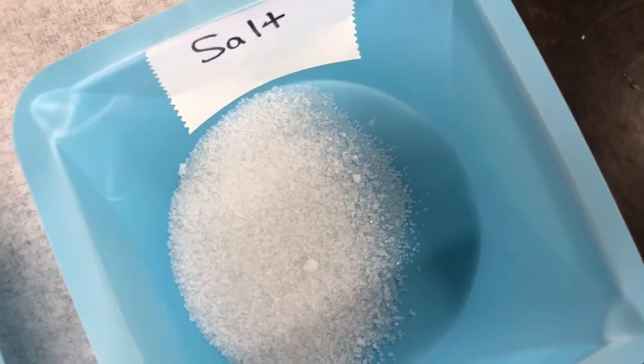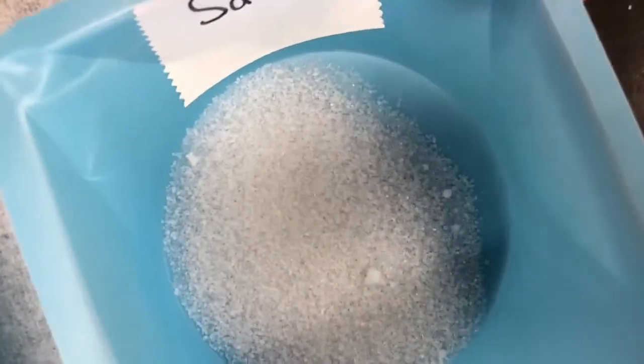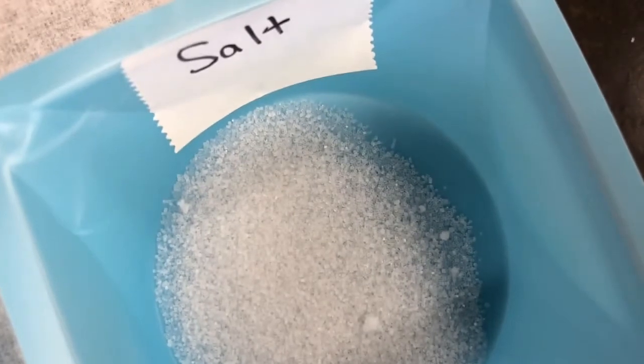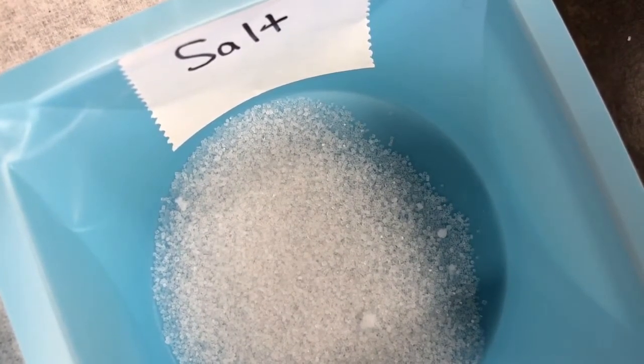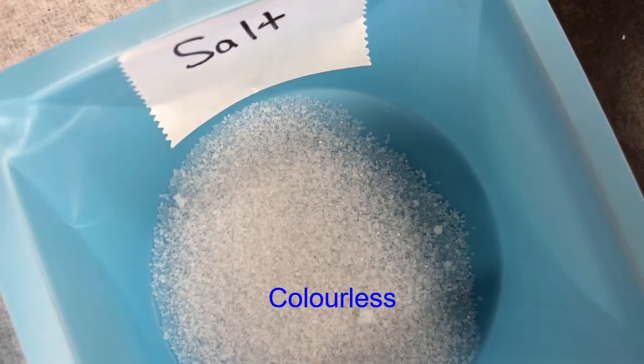But if you focus in on an individual crystal, and you should see some there at the edges that have separated out, you should be able to see that the crystal itself is actually colorless. So you can see through it. There's no color and it's transparent. So we would say that salt is a colorless substance.